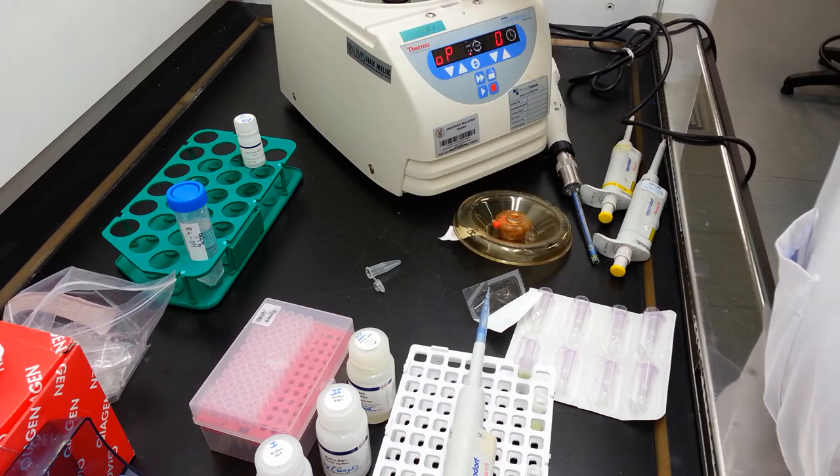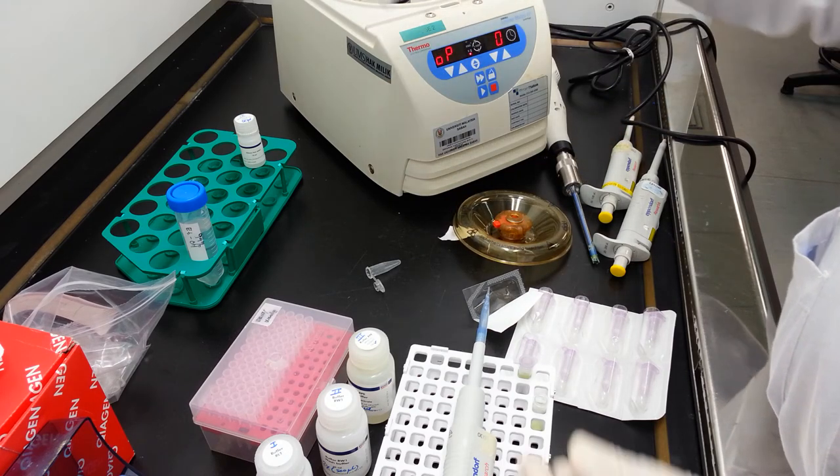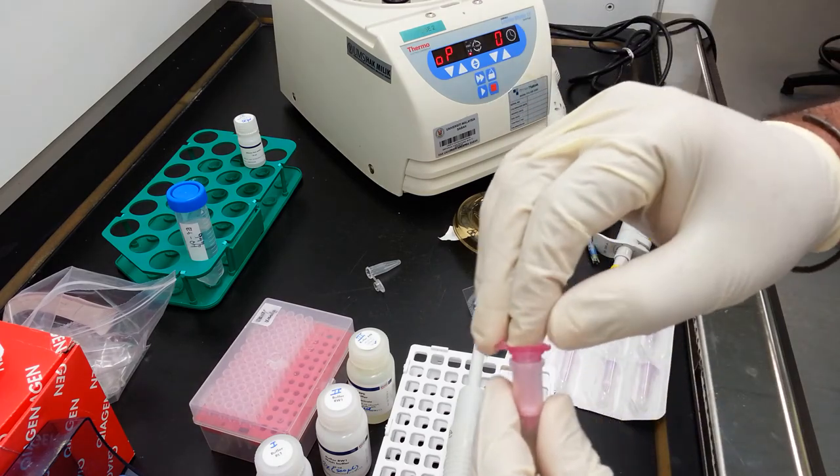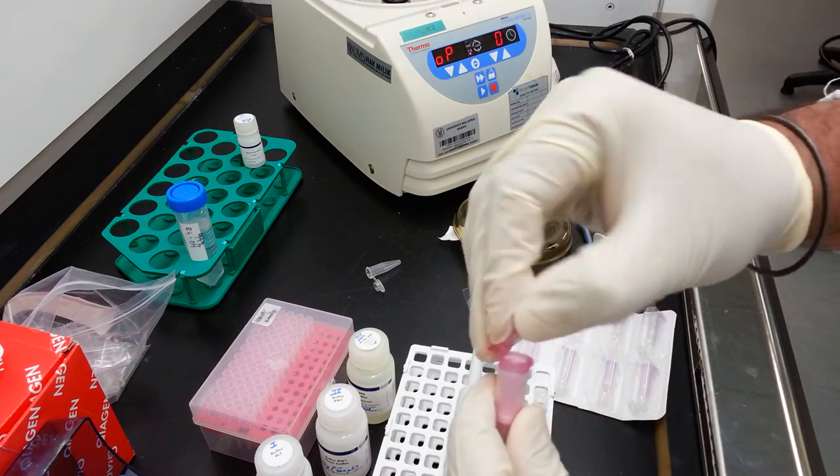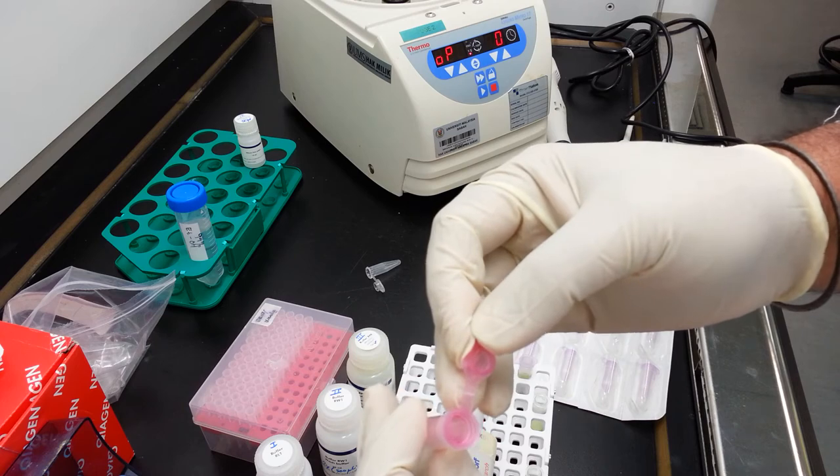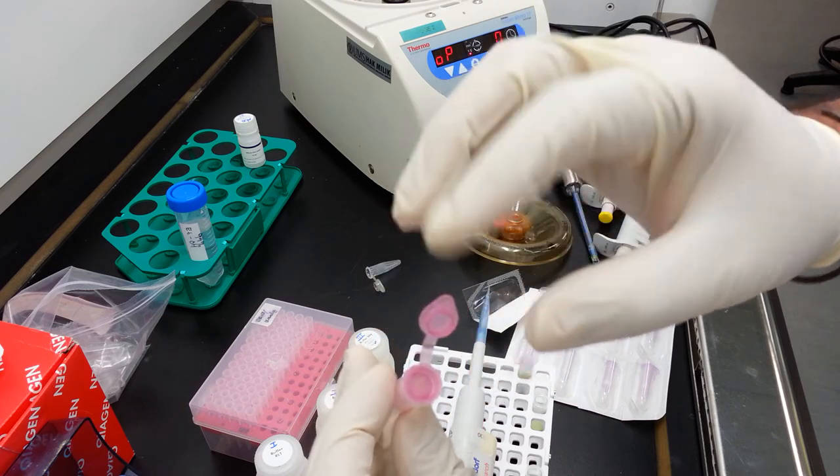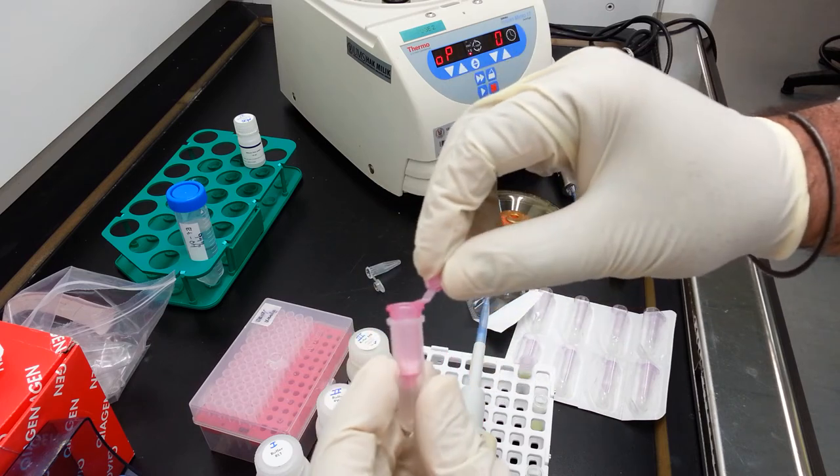When you adopt this procedure, please ensure that the tube is centrifuged for 2 minutes. After centrifugation, you can visually inspect the interior of the tube for any traces of solvent.